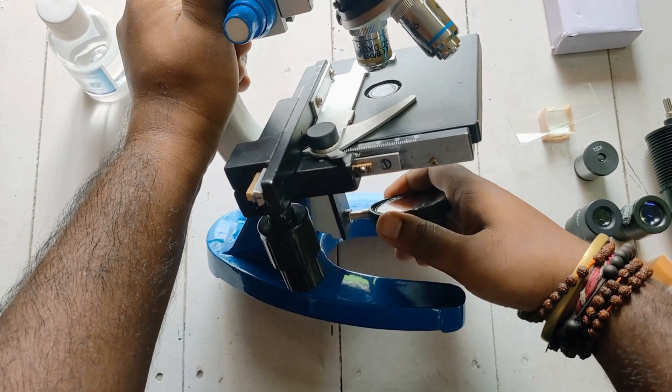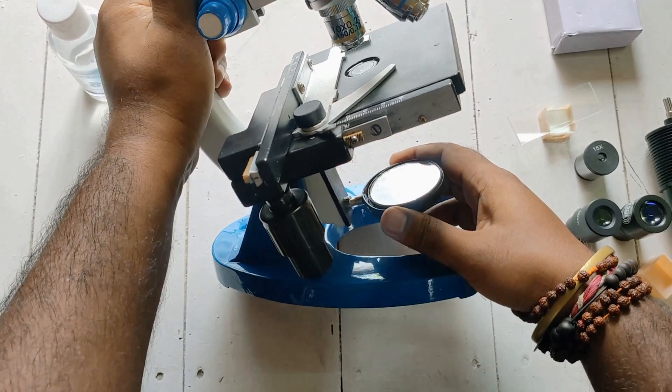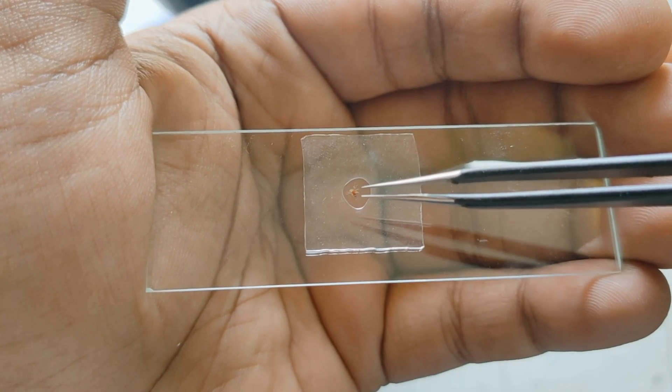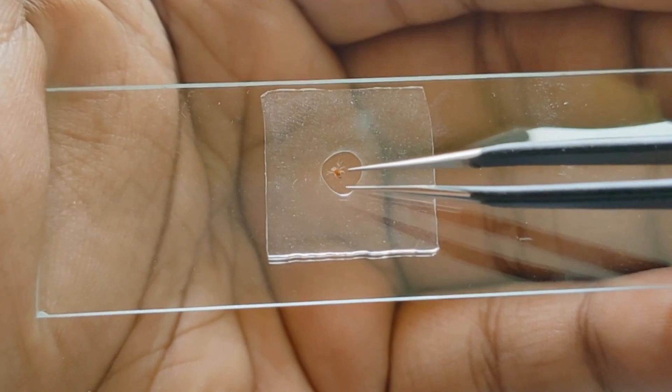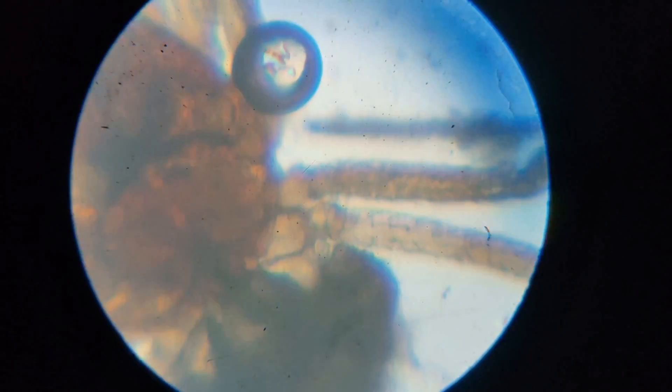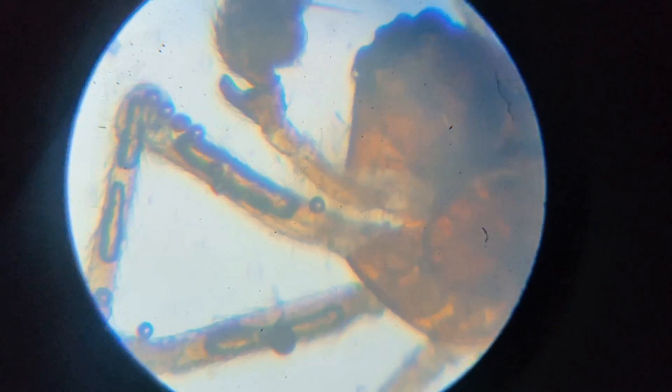Same way you can also attach the light. See here how I made these slides - a little drop of water, place a little spider, and cover it with a cover slip. Oh, look at this giant spider from Harry Potter!